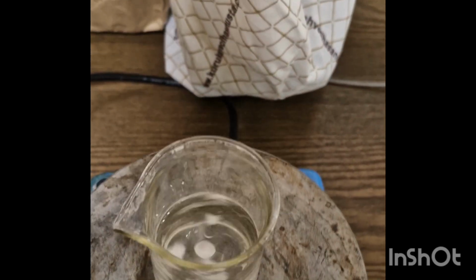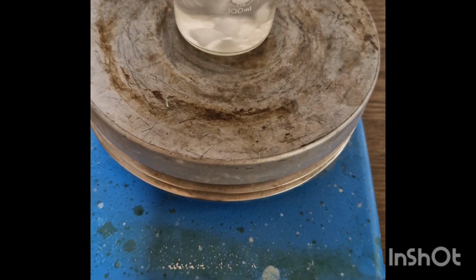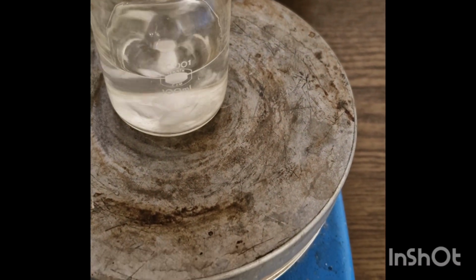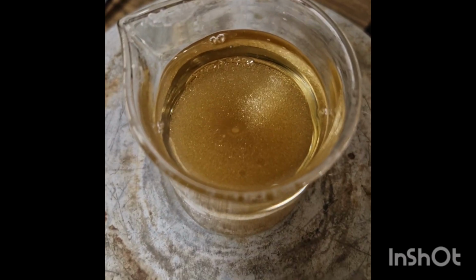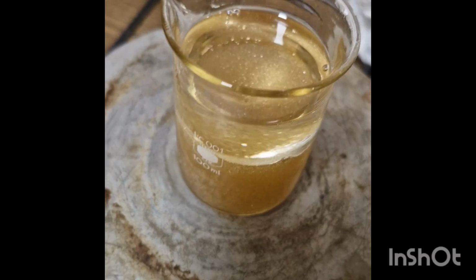Here you can see that we begin by dissolving a polymer in a solvent. Every polymer has a compatible solvent which we identify using standard chemical handbooks. So after fully dissolving the polymers in the solvent, we add graphene oxides, a highly conductive nanomaterial with remarkable surface area and unique electrical properties.